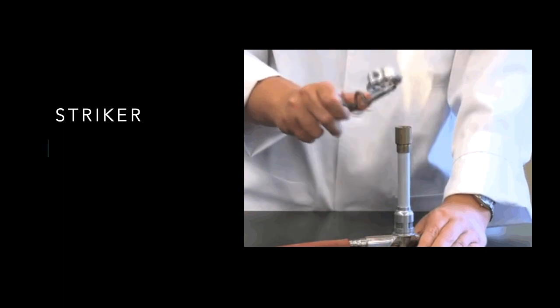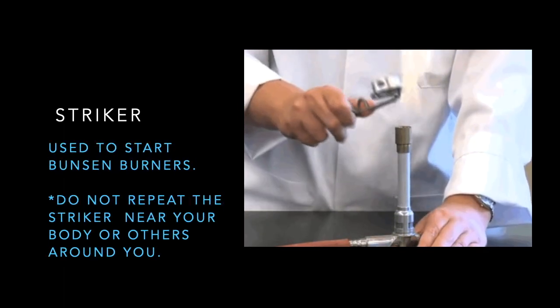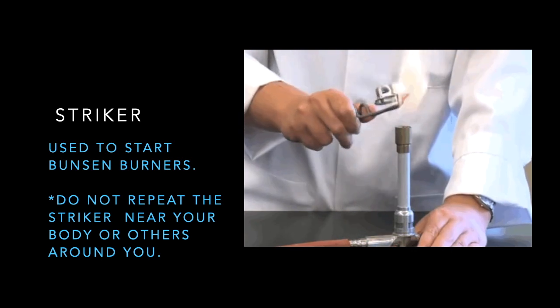Striker: used to start Bunsen burners. Do not use the striker near your body or others around you.